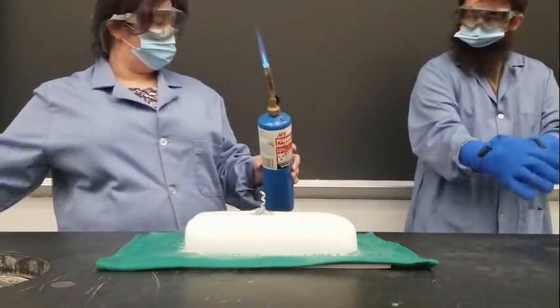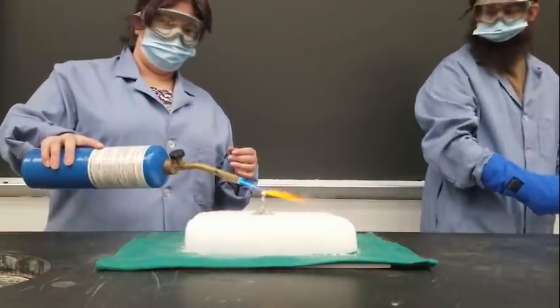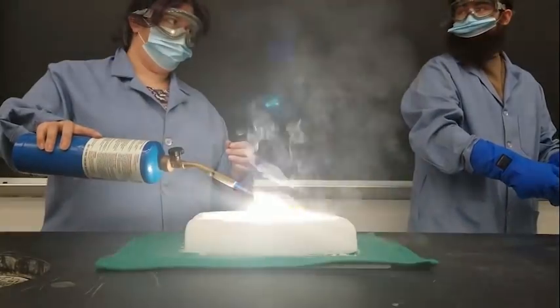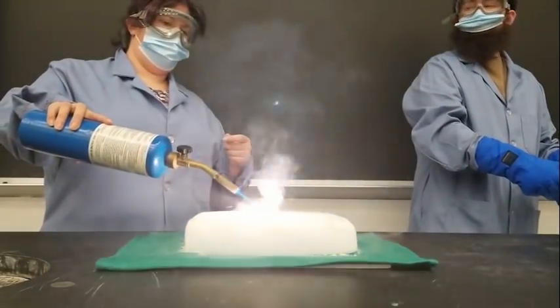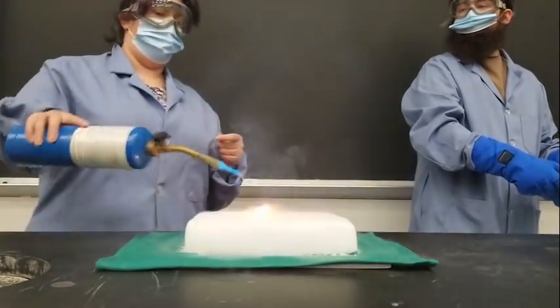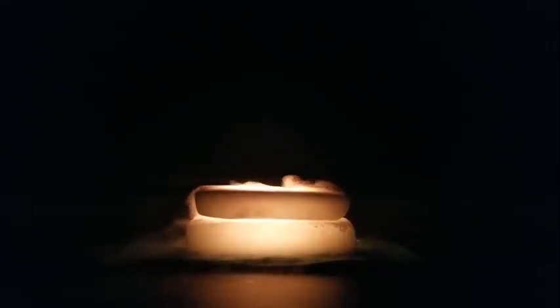This one has nothing to do with candy, but is still one of our favorites. We call this combustion of magnesium in dry ice, but it's really a single replacement reaction. Once the magnesium is lit, it burns without needing oxygen and exchanges places with the carbon to produce magnesium oxide and solid carbon. That orange color you see is from the carbon itself burning.